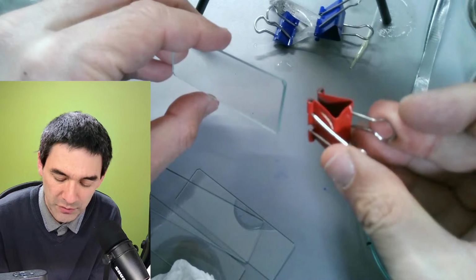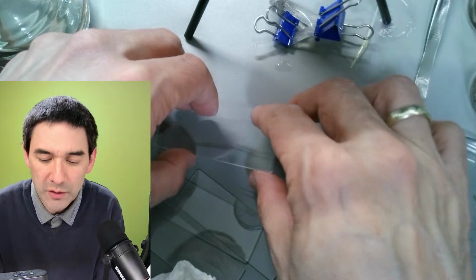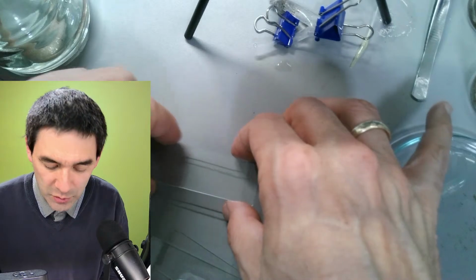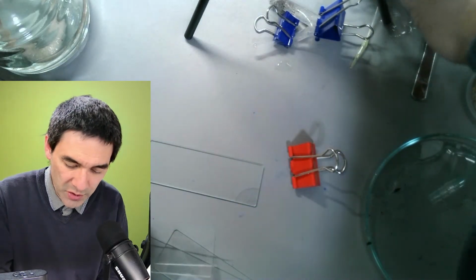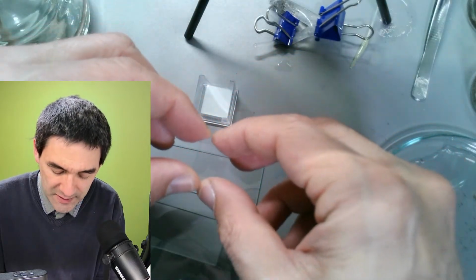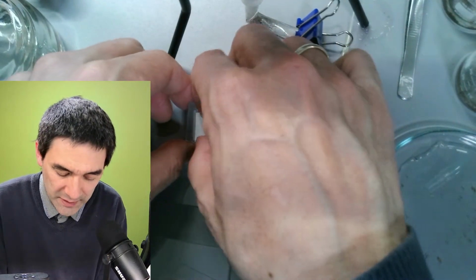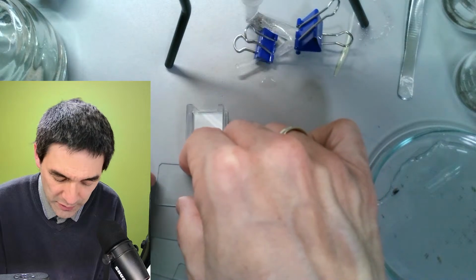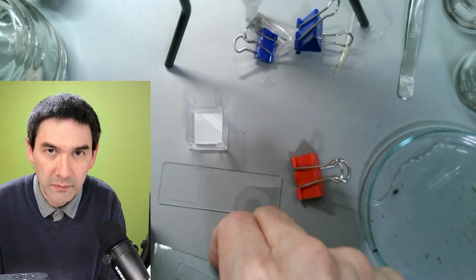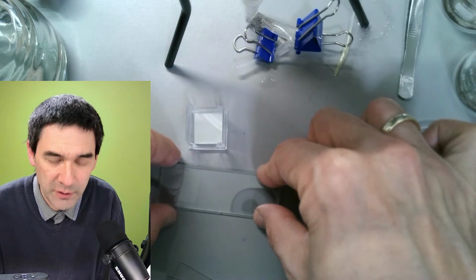Okay, those clamps here. So reason number two where they are used is the following: when you are preparing insects, I'll also show you how this works. What you do is you take two cover glasses, one on the left here, one on the right here. I don't have an insect right now that I can show you. You put the insect in here, after it's been treated, and then you put the second slide on top.